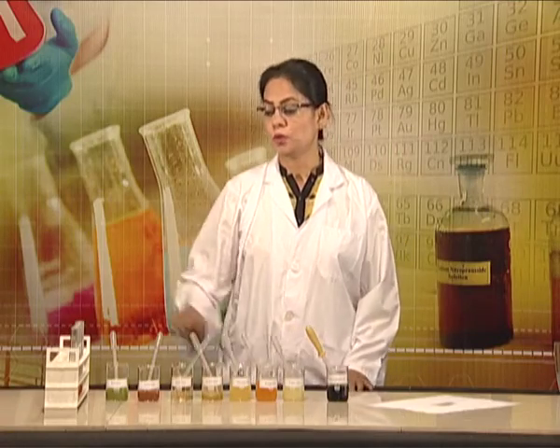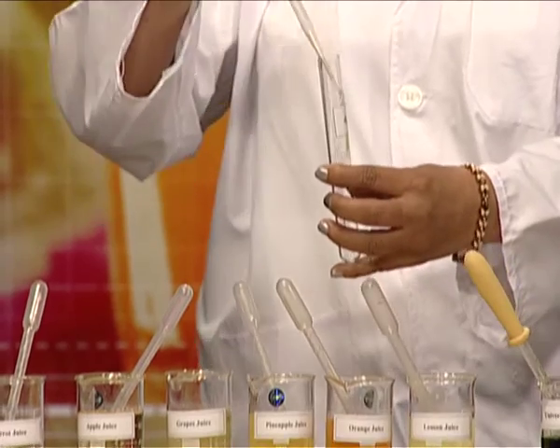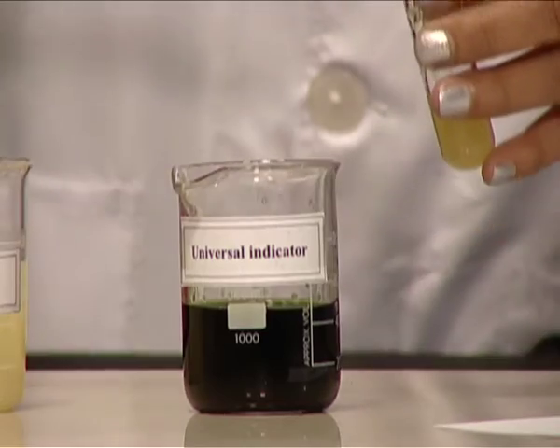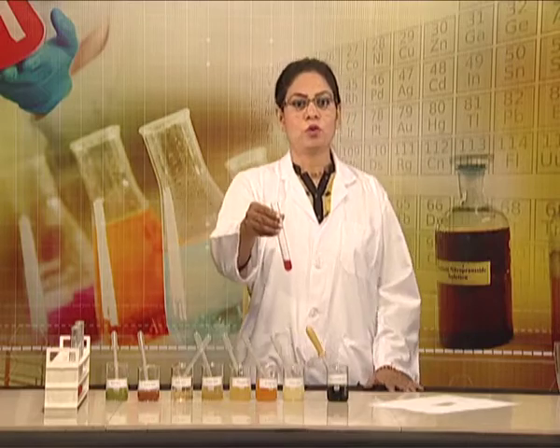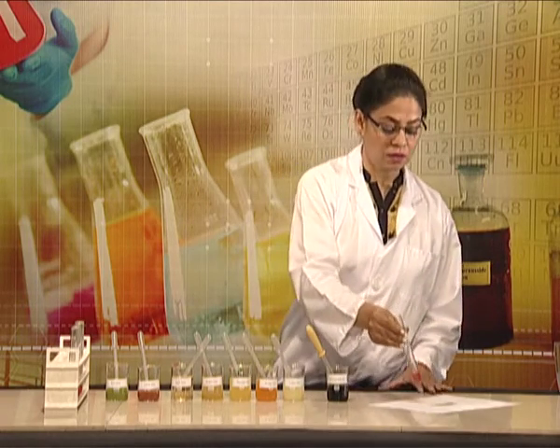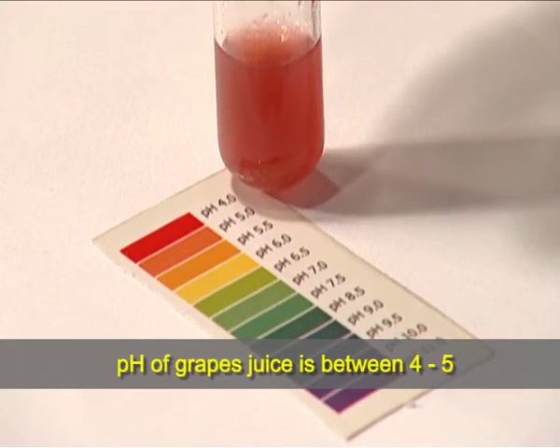Let us take test tube number 4 and add grape juice in it. Now, I am adding universal indicator, shake it thoroughly. The test tube number 4 in which grape juice has been taken shows crimson orange color with universal indicator and pH range is between 4 to 5.